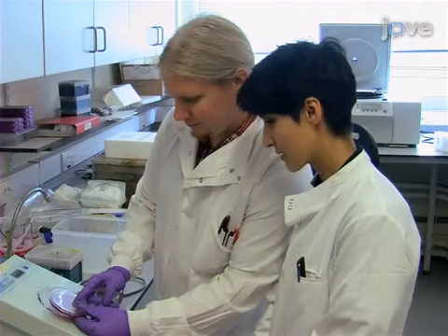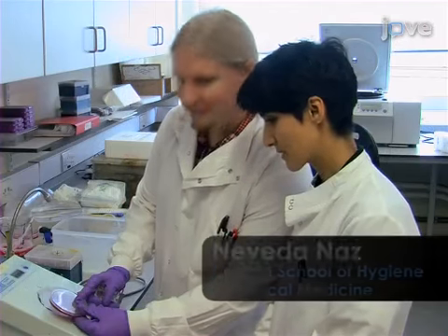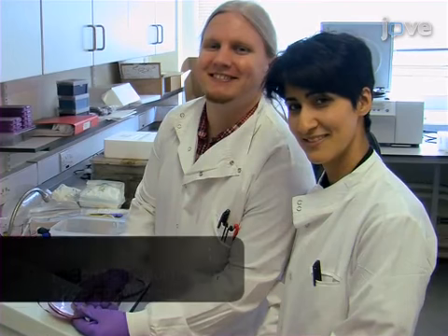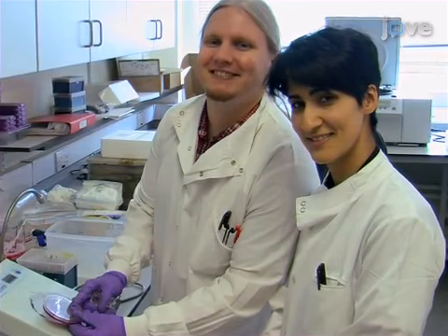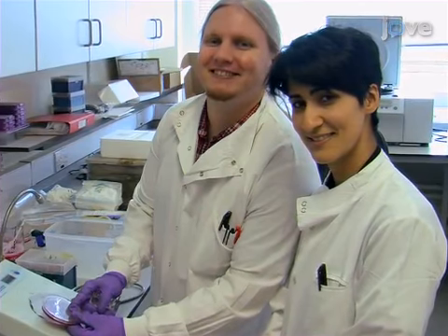Demonstrating the procedure will be Naveeda Naz, a PhD student from the laboratory, and Dominic Mills, a postdoc who developed the Vertical Diffusion Chamber model as part of his PhD in the laboratory.